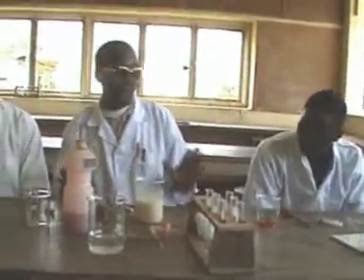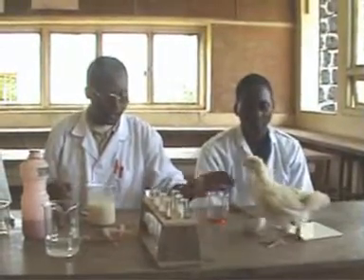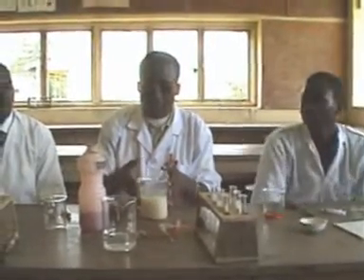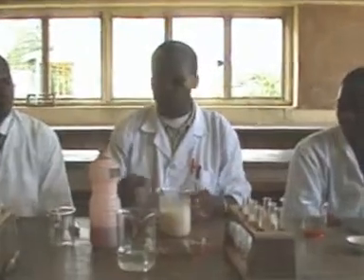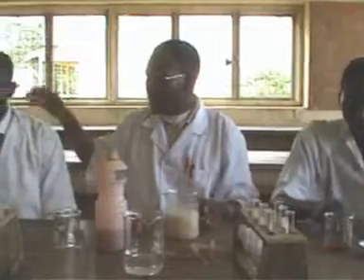So we are going to carry out the food test. The procedure is, we are going to follow it as such. He will test for the presence of starch in solution A here, using iodine solution. Then I will carry out the test for fats in solution A using filter paper, and I will also use the Sudan 3 solution. Then he will carry out the test for a simple sugar using solution B, and he will use Benedict's solution. Then the third person will carry out the test for proteins using still the same solution B, and he will be using the Millon's reagent.